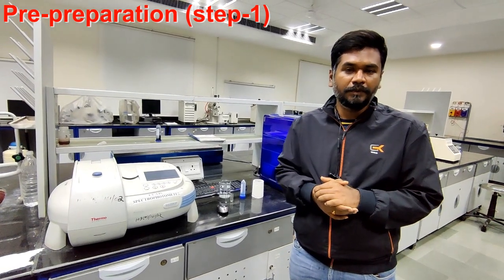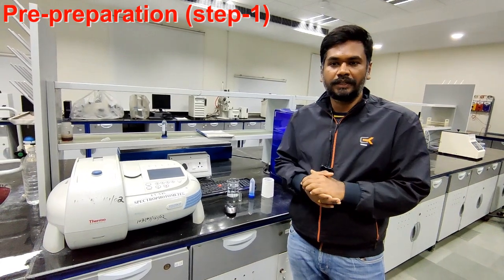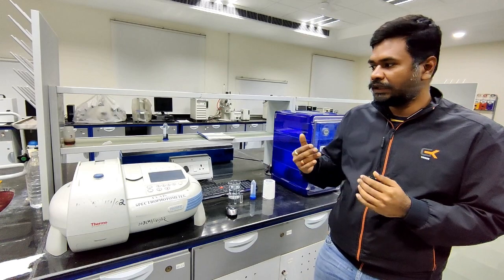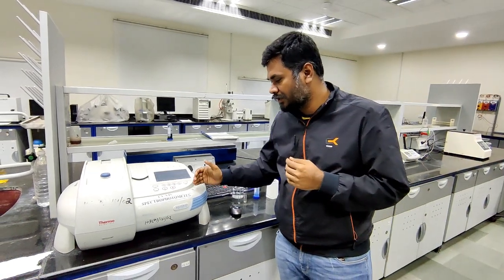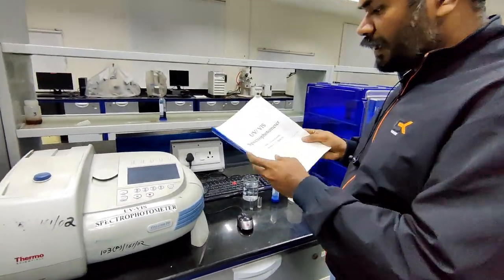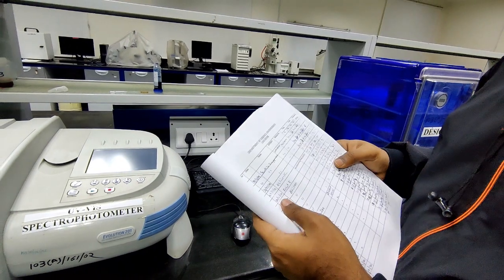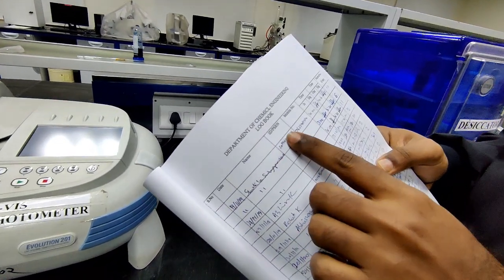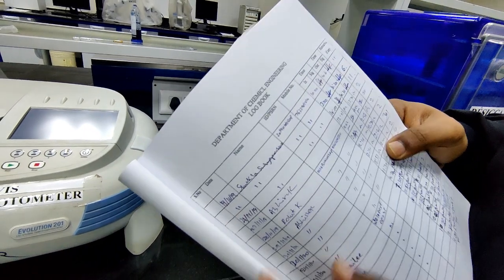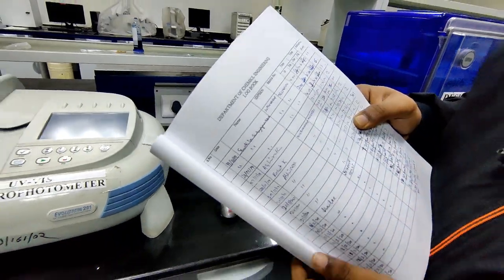Now I'm explaining the pre-preparation of the experiment. Step 1: before entering the analytical lab, you should enter your details in the analytical logbook. Then after coming to the UV visible spectrometer, here we have one more logbook. In this logbook you should enter date, name, ID number, mobile number, and time in and time out. And in the remarks you should enter how many samples you have performed.